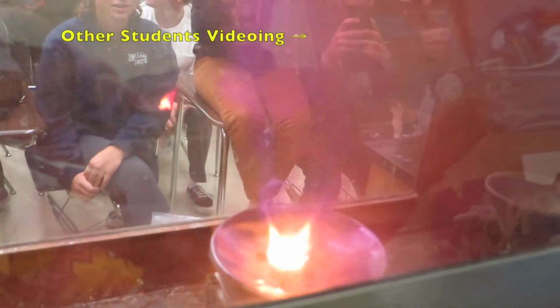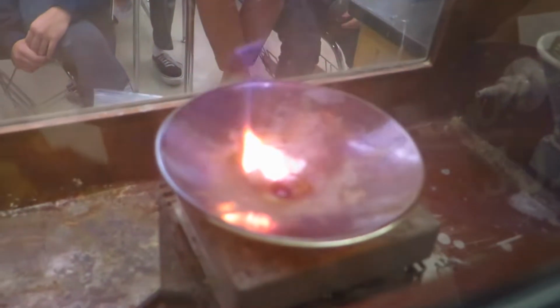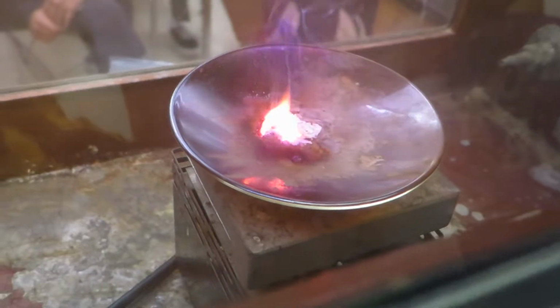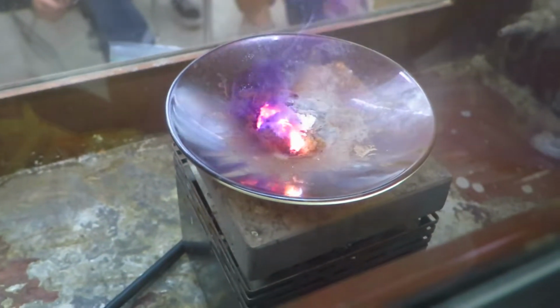Whoa. This might just be the coolest thing ever. And you can see that purple is iodine vapor. It's a color I've never seen before, and I didn't think that was possible. And now it's very exothermic, so it will catch fire like you can see here.